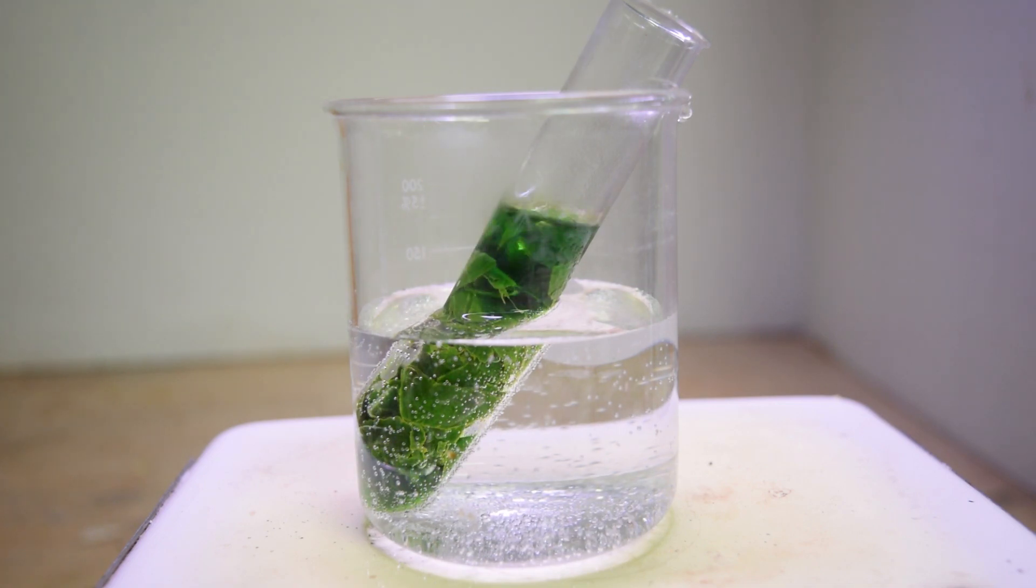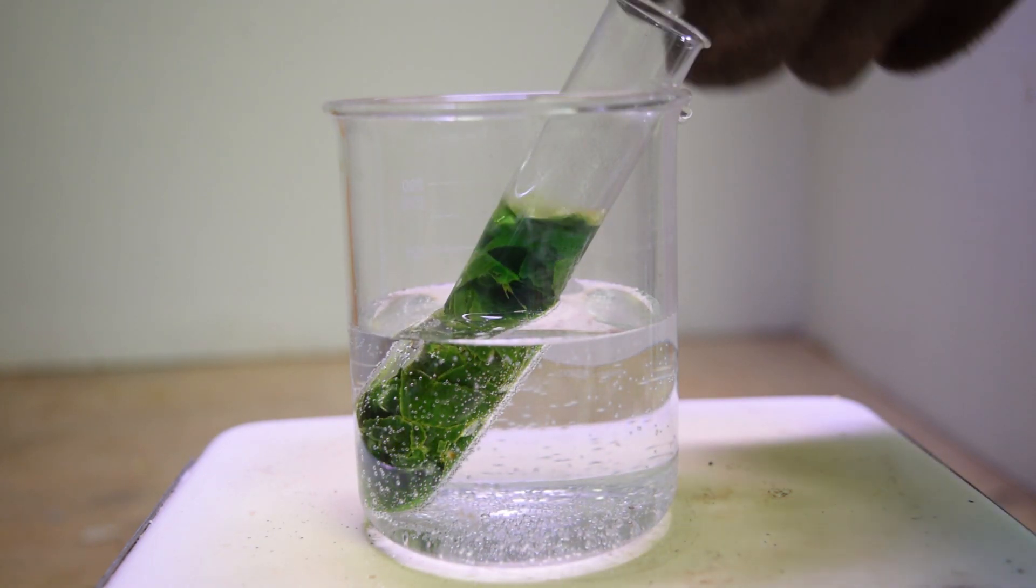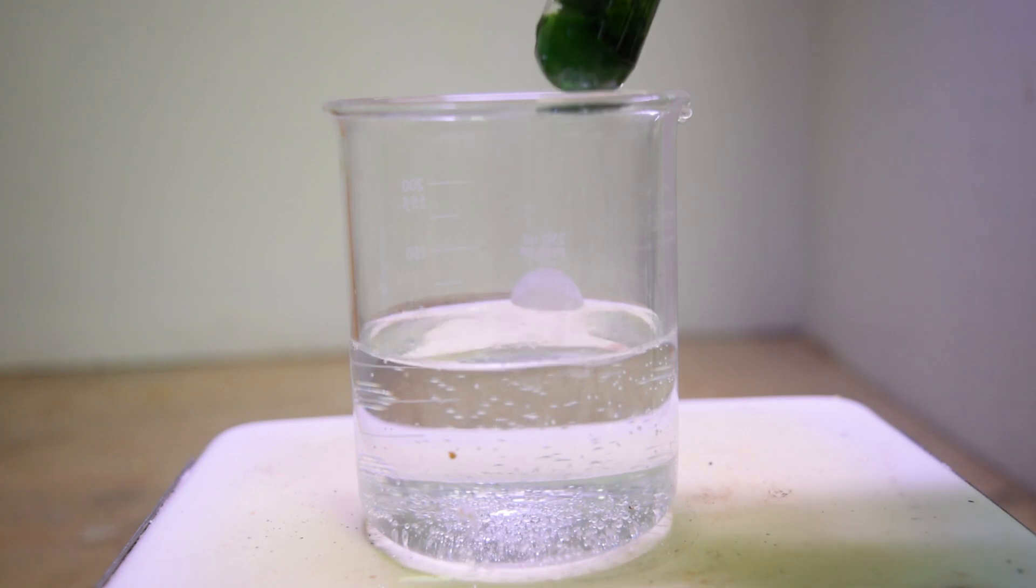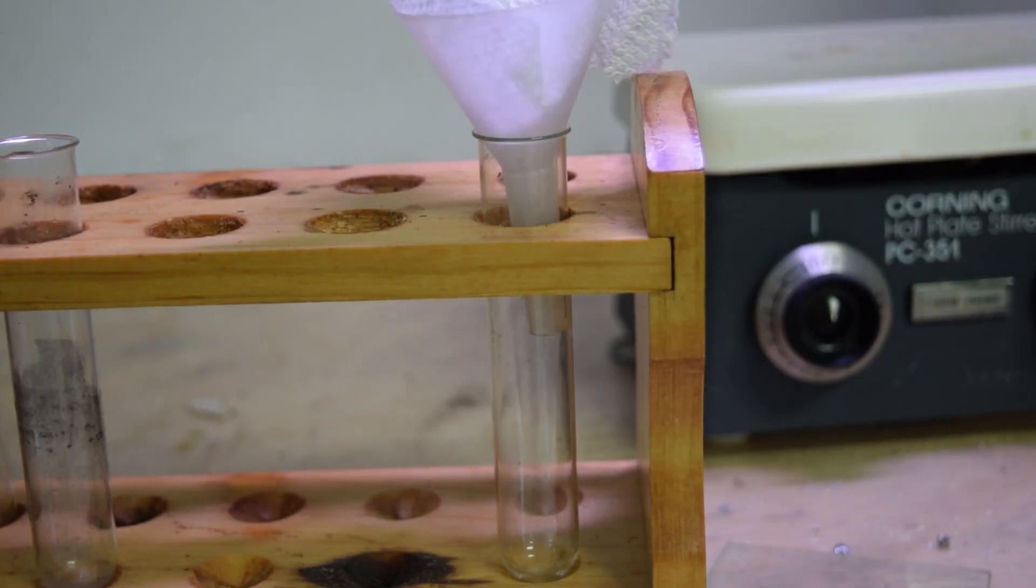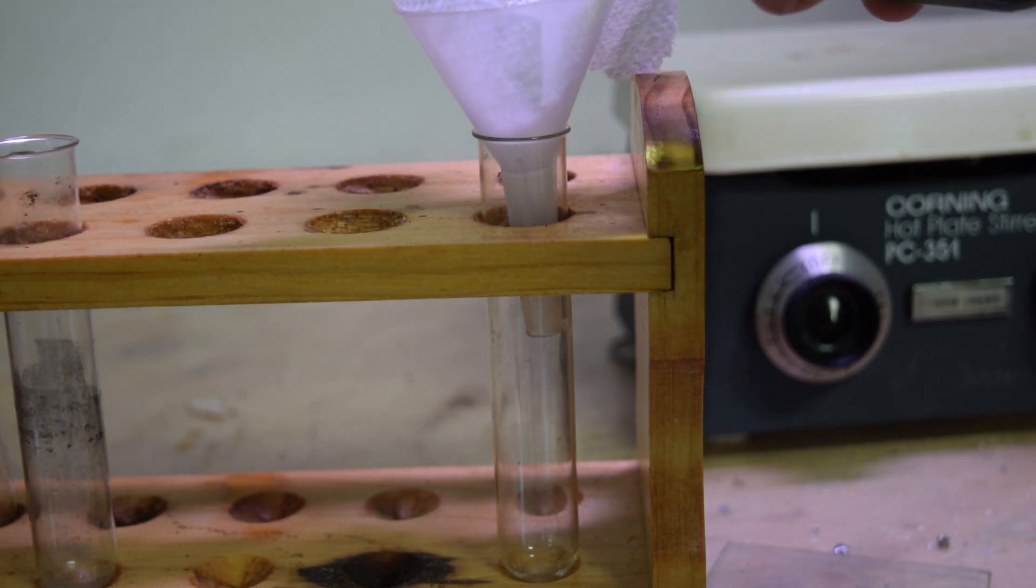It's been about 10 minutes now and the ethanol is at a raging boil. As you can see, it's a very dark green color. I'm going to go ahead and take it out and we'll just filter it to get rid of any solid contaminants.